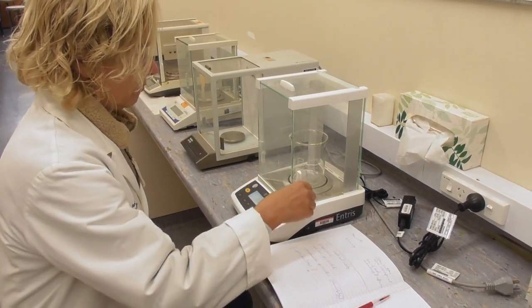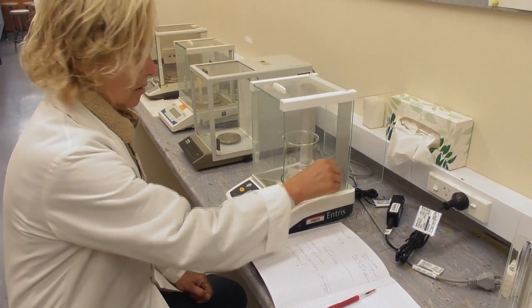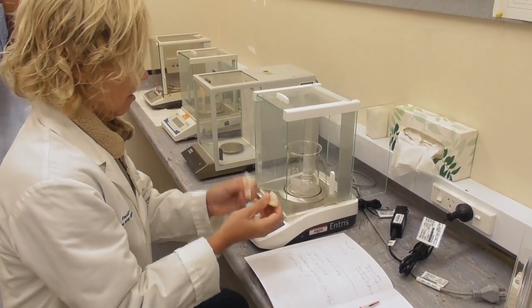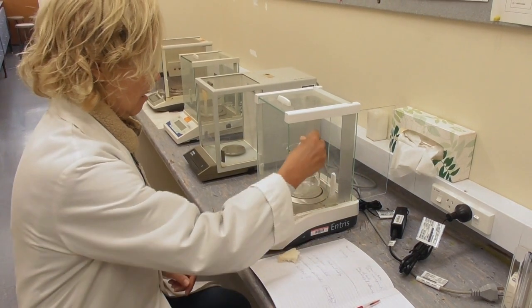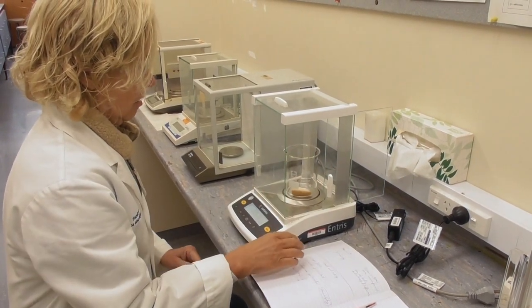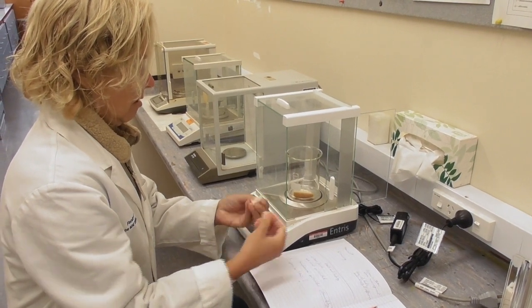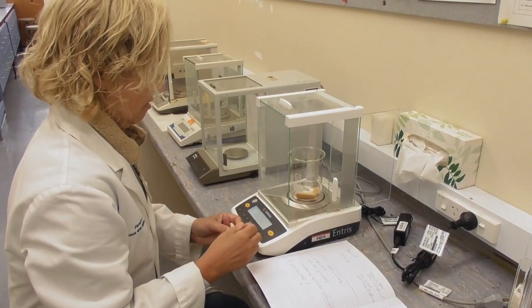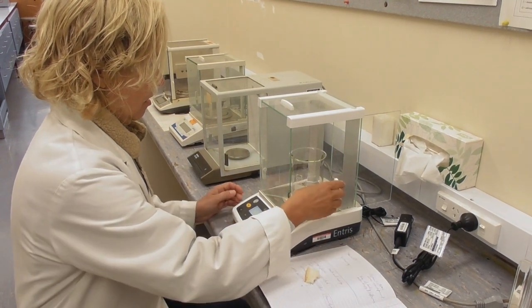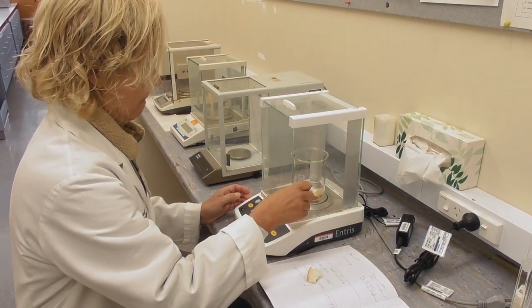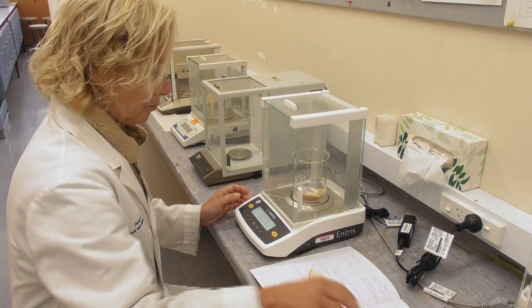I need to weigh out between two and three grams of bread for this experiment. So I put a chunk into the beaker to see where I am at and might add a bit more. It doesn't really matter how much bread I have as long as I write down the exact weight of bread in my beaker.